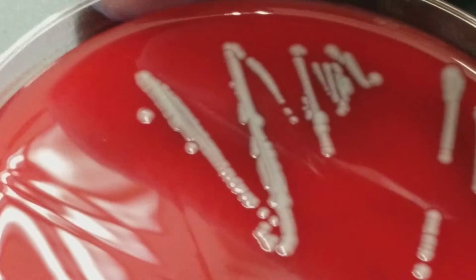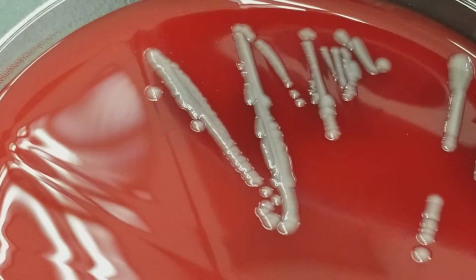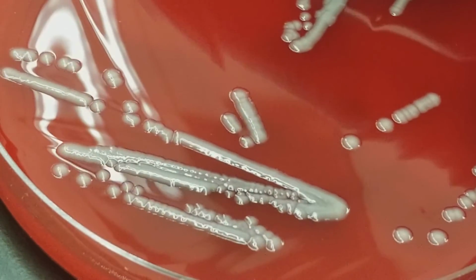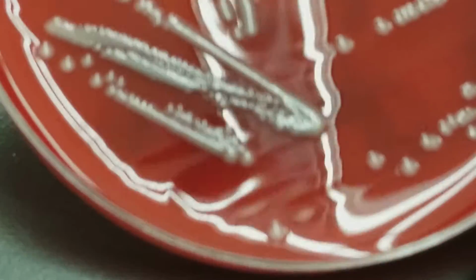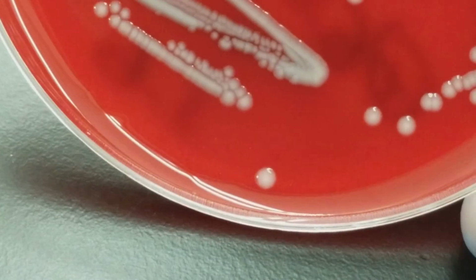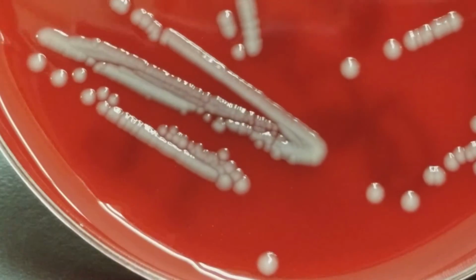So this person had acute appendicitis. I don't mean to sound excited about that, but this is E. coli, Escherichia coli, and it is a GNR as well, and it is part of the family Enterobacteriaceae. We can see some of that scalloping there. If my phone would focus, I'm so sorry. There we go.